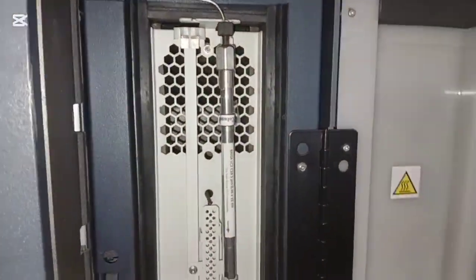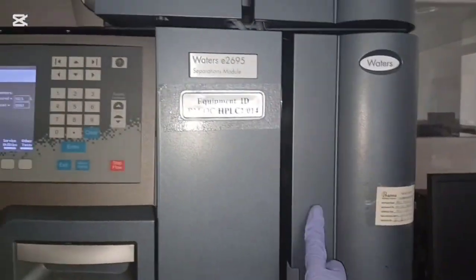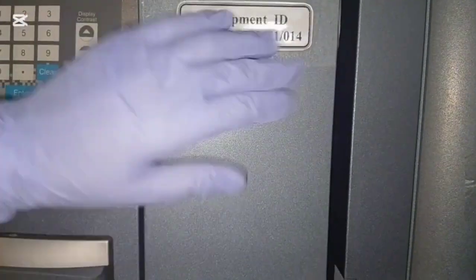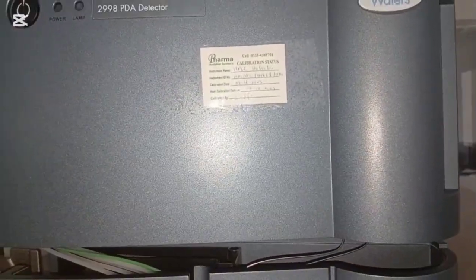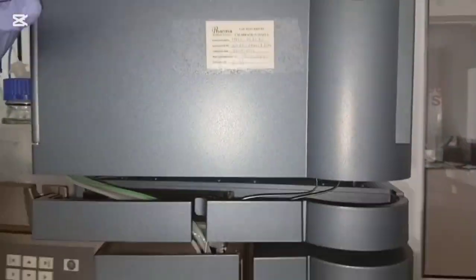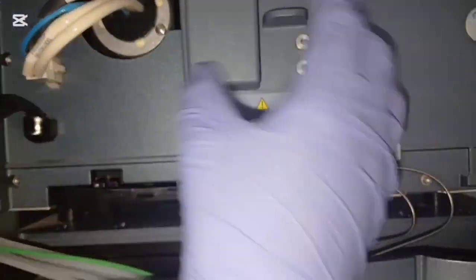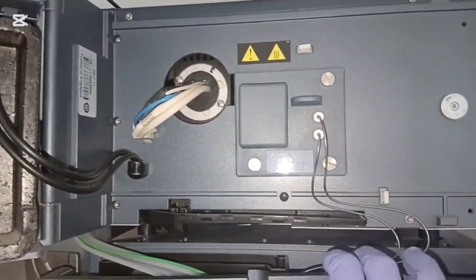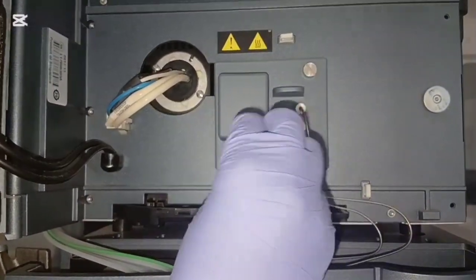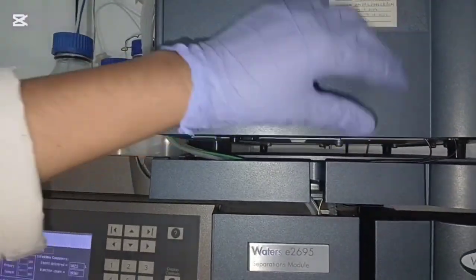Step 5. System Components Overview. Pump section uses 4 reservoirs, A, B, C, D, for solvents. Column oven. The column is placed here. You can check its temperature with a thermometer during calibration. Detector. Usually a PDA detector, but others, like RID, can also be used. Inside there's a D2 and W lamp and a flow cell where light passes through the mobile phase for detection.